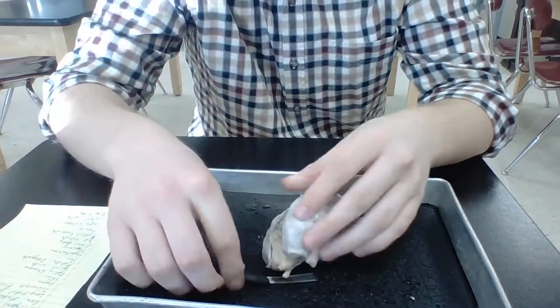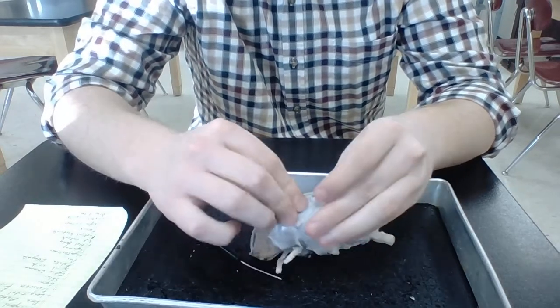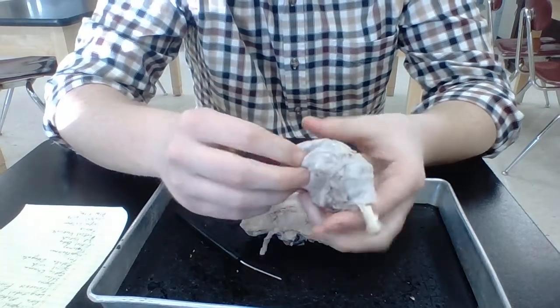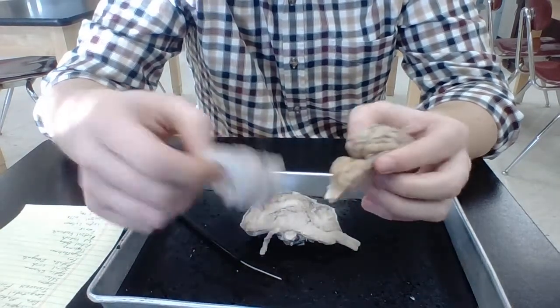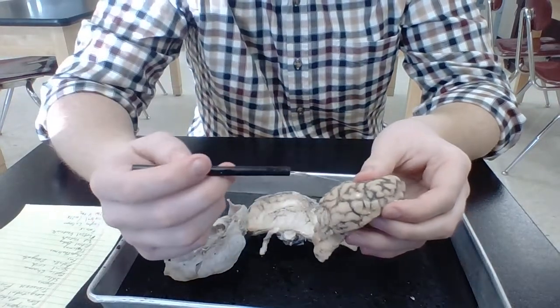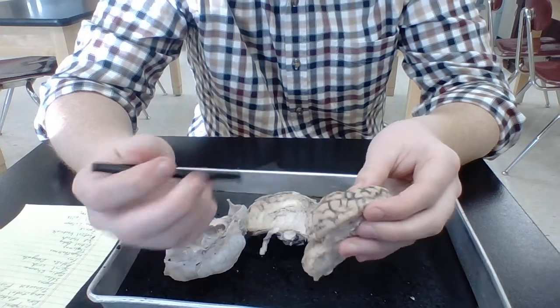Now, when you look on top of the brain and the cerebellum, so this kind of pops right off. Kind of nice how that works, right? You have a number of ridges, and you also have these grooves. So this is the space in between them. All right.